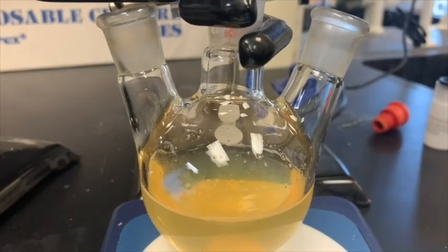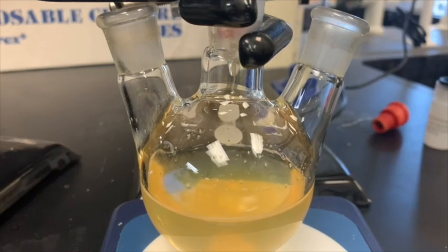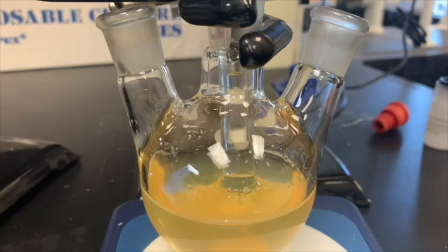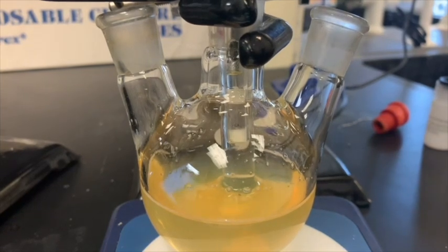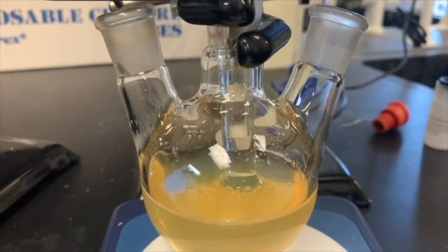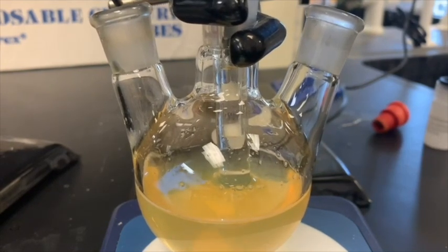Next, we will begin preparing the reference electrode. In this case, a silver-silver chloride electrode. This one is pretty simple. Just remove it from the buffer solution and put it into the middle neck of the round-bottom flask, adjusting it to the height necessary.